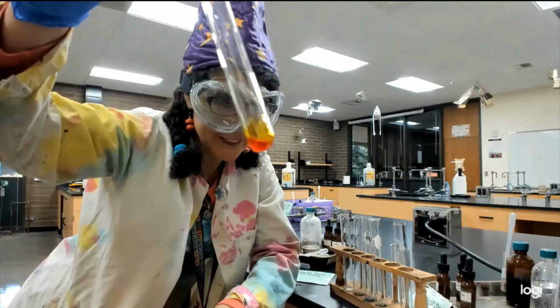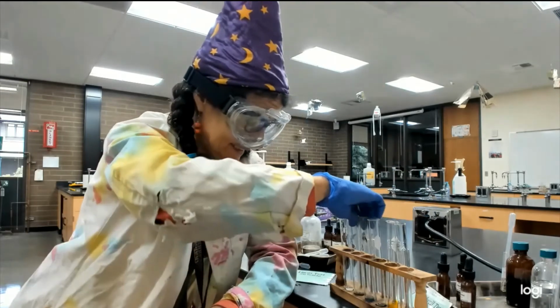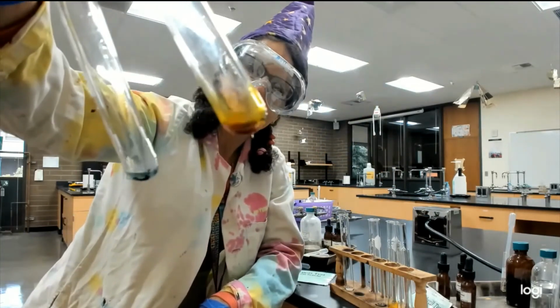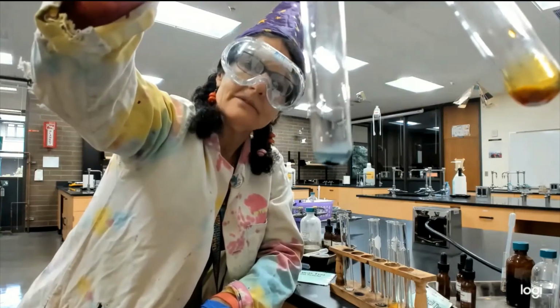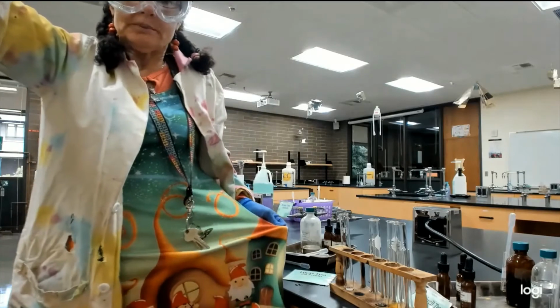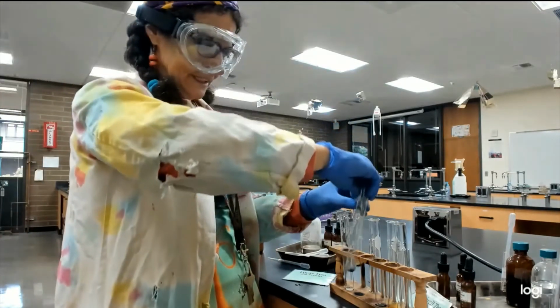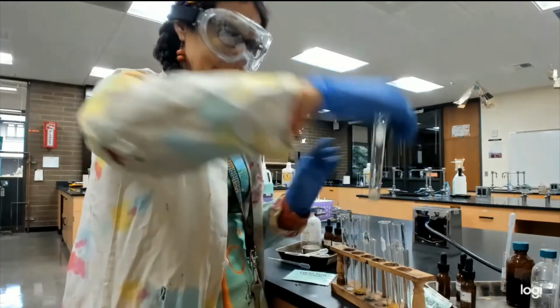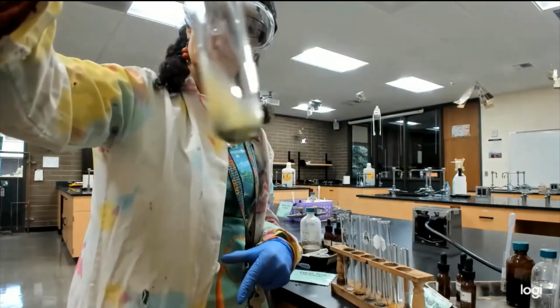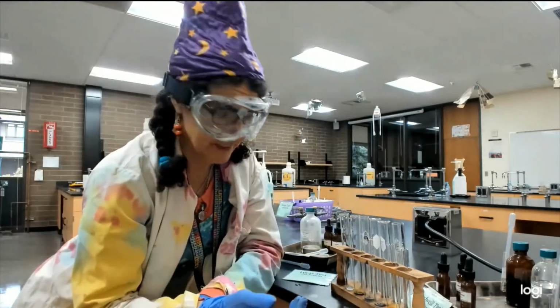This is the tertiary alcohol. This is a test to tell us we have something that oxidizes. So our aldehyde turned a funky orangish color. That green, this is the test for what I was wearing today, my gnomes. So the green tells us, it's camo green, that it's a primary, secondary alcohol, or it was an aldehyde. I just wanted to try the aldehyde because I'd never done that before.